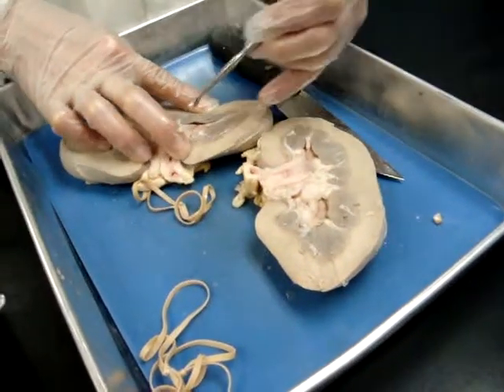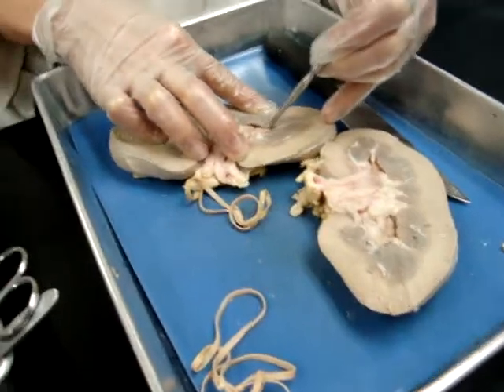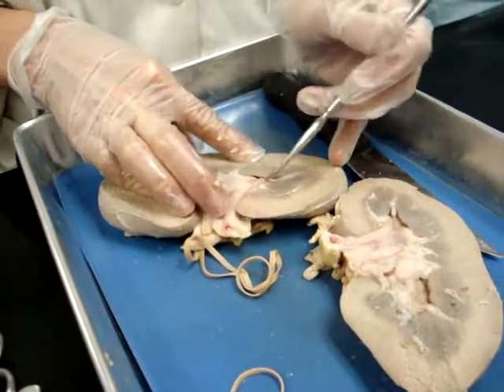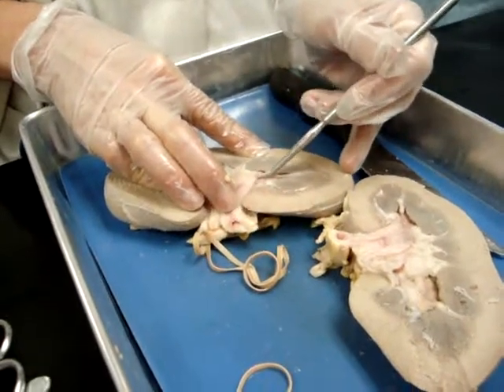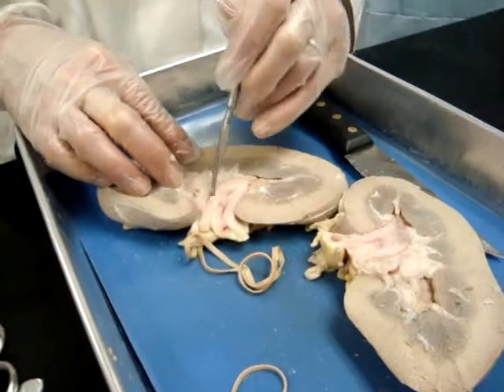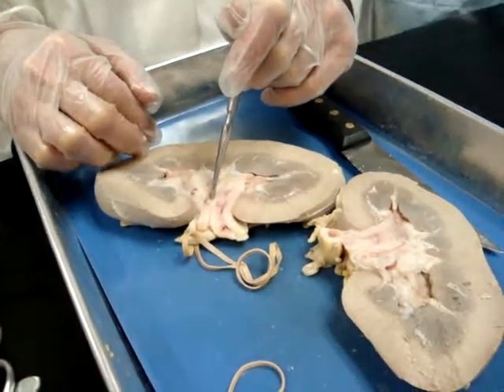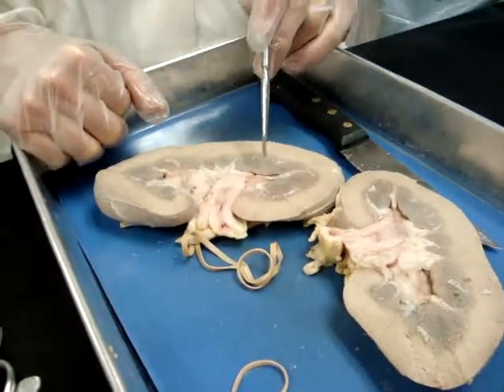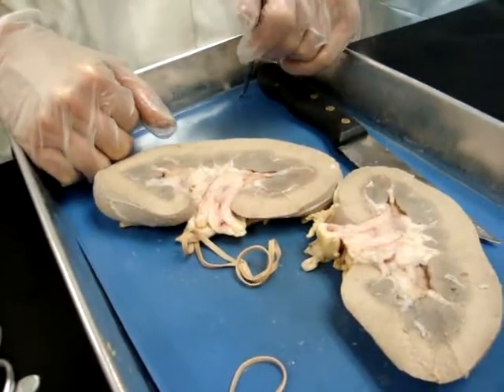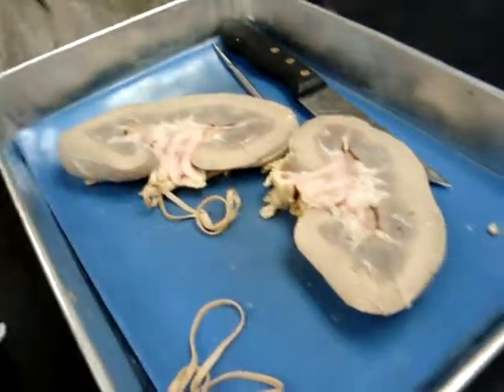So if I'm pointing to the space around the papillae, that's a minor calyx. If I'm down in here, I'm in the major calyx. If I'm over here, that's the pelvis. Use the papillae as your landmark.